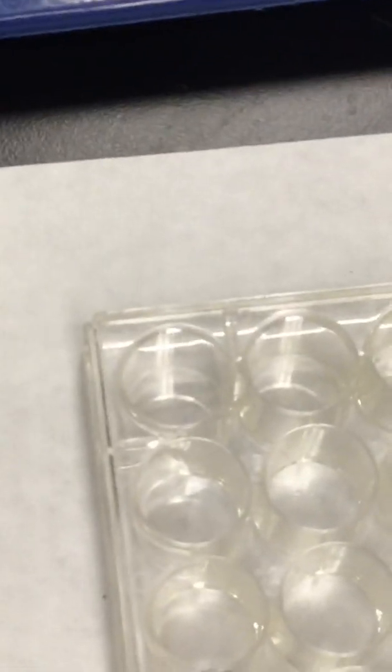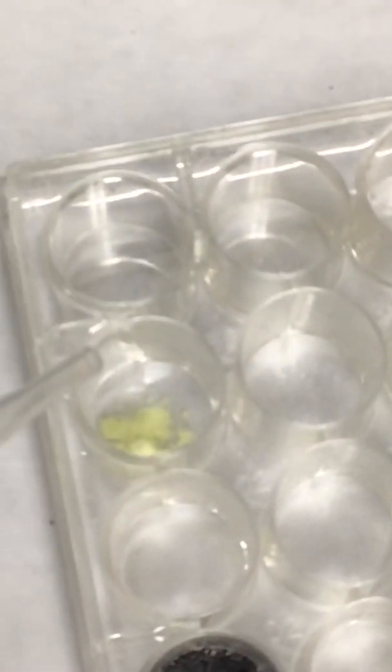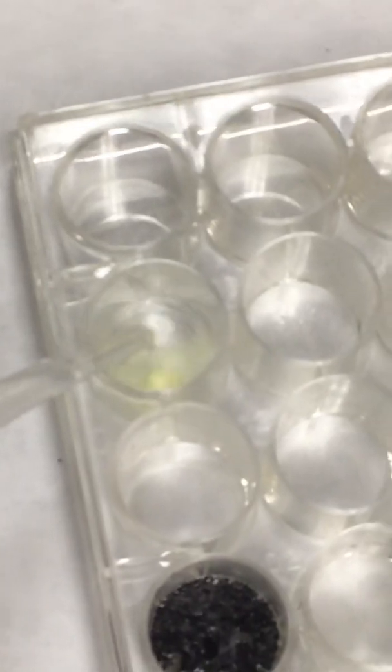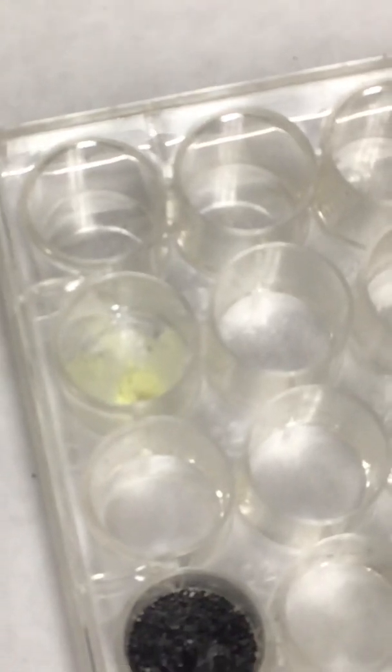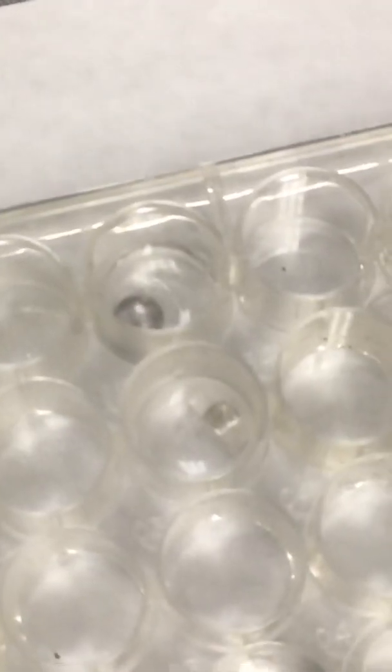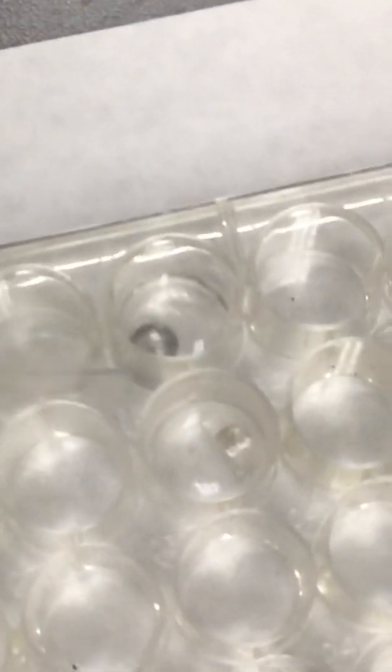Do we have that spatula? I brought your clean one. Thank you. Where are we at? Right here? Looks like pond scum. All right, and the last one we have is aluminum. Ready? Yeah, ready. You may need to cover that. If I remember correctly, the last time we had to work, there's some oxidation.